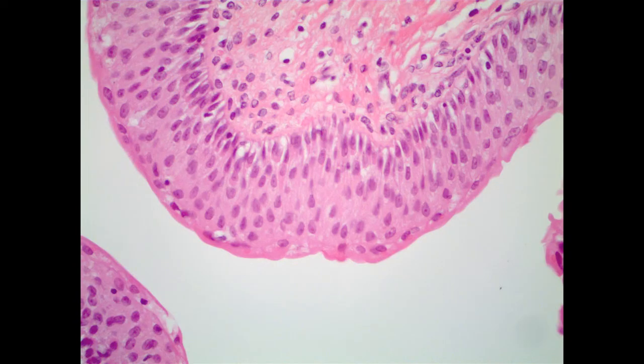The next slide is actually of our sixth ET type that we're learning in lab, and this is also a stratified layer. But it has a unique name. It's called transitional ET, transitional epithelial tissue. And the reason for that is this is the type of ET we see lining our bladder and other aspects of our urinary system. And if you think about the function of the bladder, it's to store urine, and therefore it needs to expand as urine increases, and then sometimes it'll empty and shrink back down. And so things that need to expand need to have a surface layer that can stretch without tearing. And so here is a stratified layer, it goes from here to here.